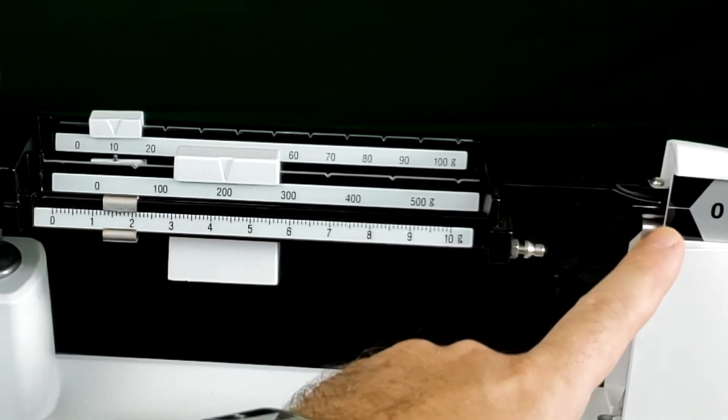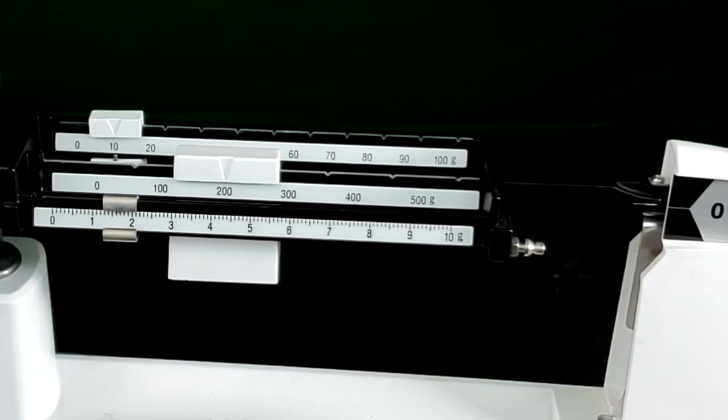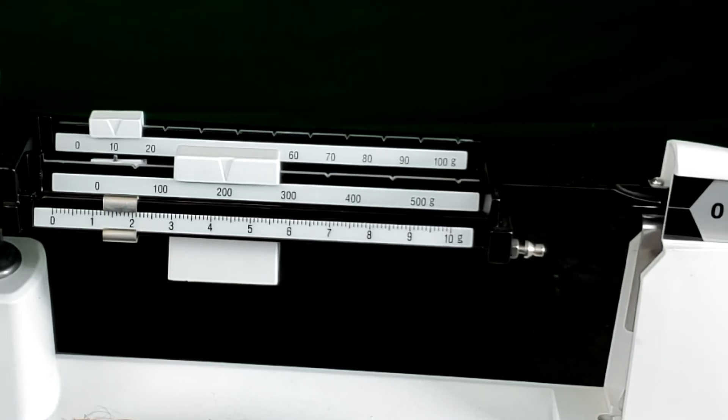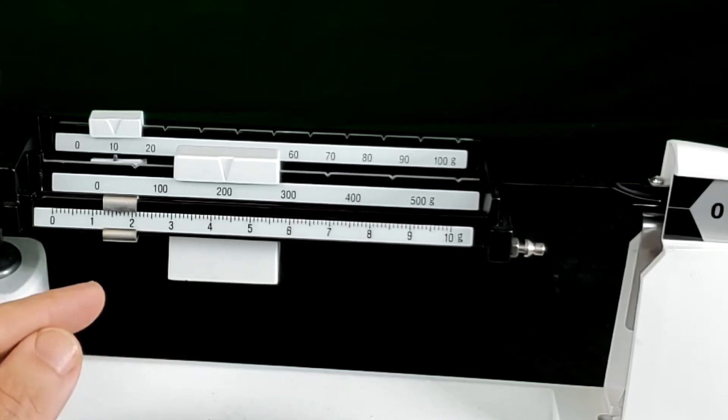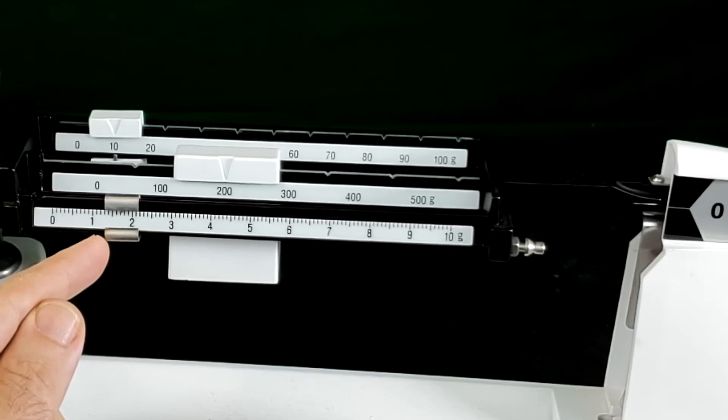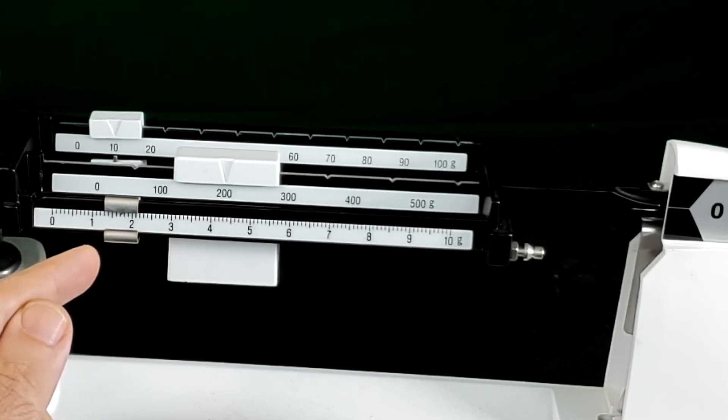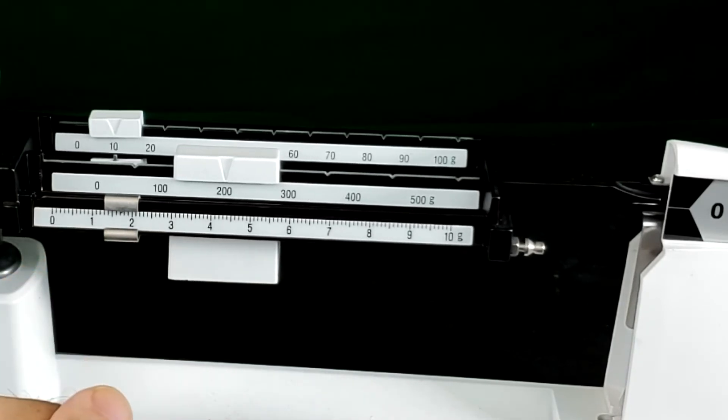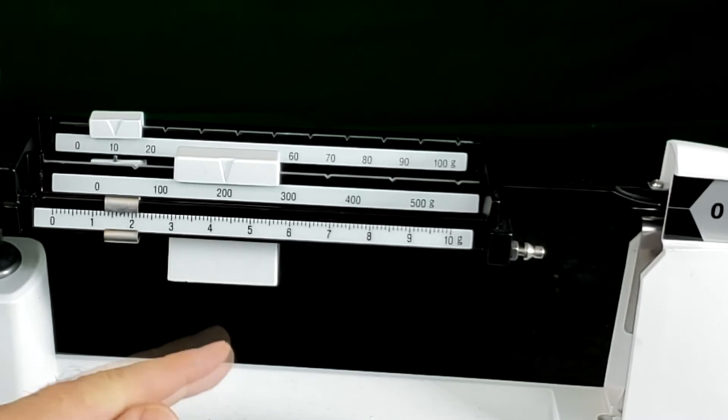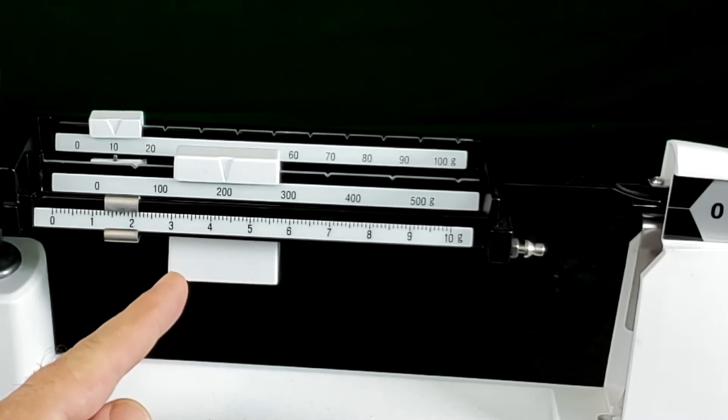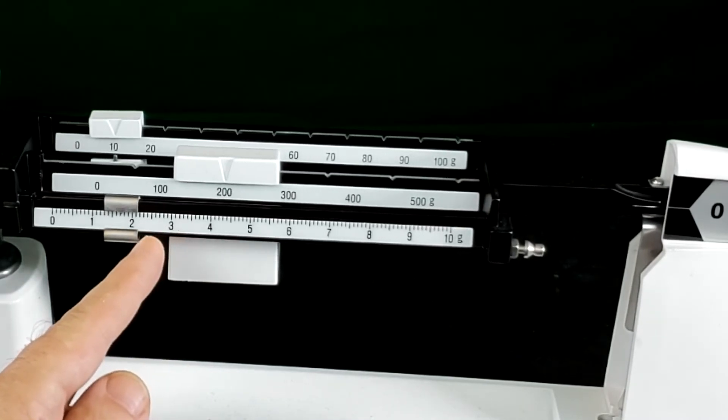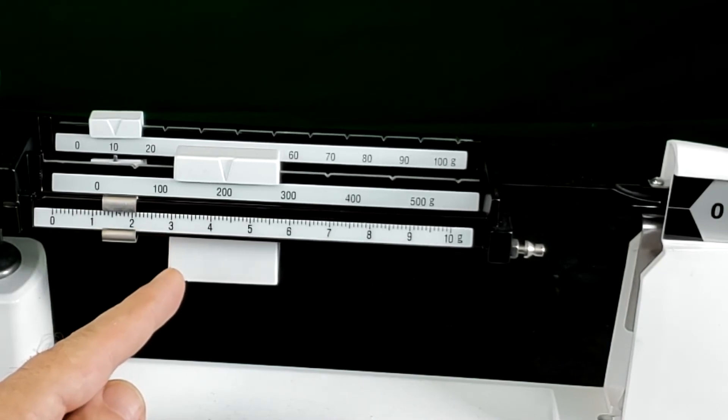My goal is to get that line exactly lined up which looks like I'm really close right now. I think that's actually just about it. Don't force it to stop swaying up and down, you have to wait for it. I may have gone a little too much, back it up just a little bit.